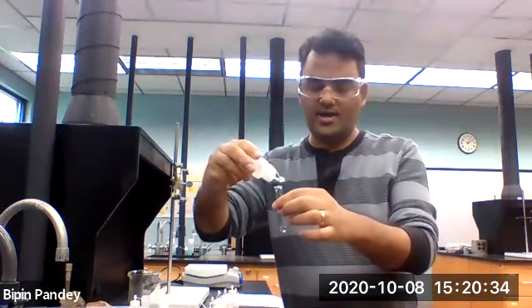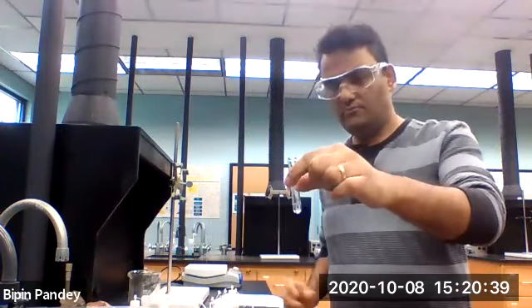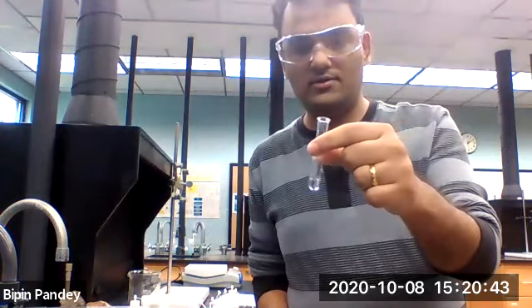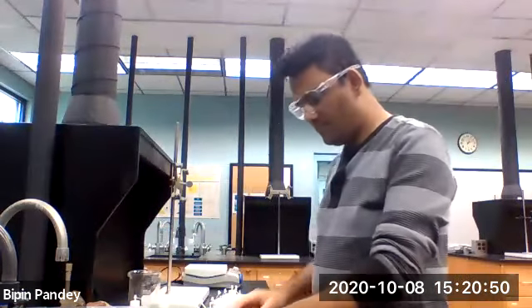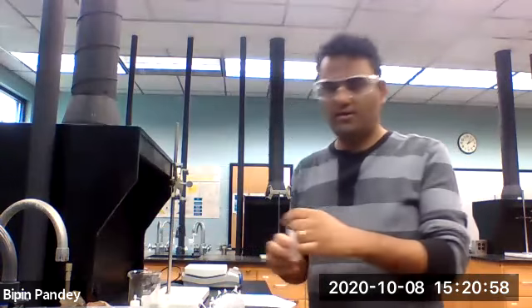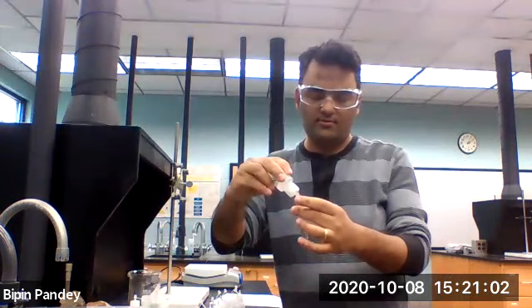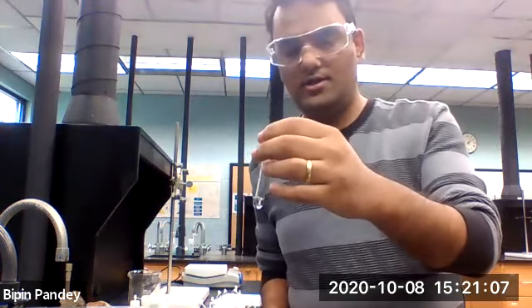Take phosphate anion using sodium phosphate. Solution is clear, no reaction. Take sodium cation using sodium chloride. Take sulfate anion using sodium sulfate. Mix together. Solution is clear, no reaction.